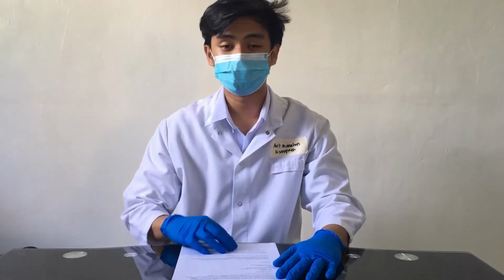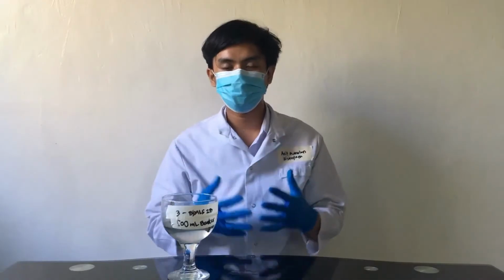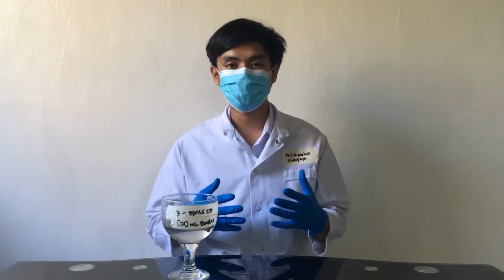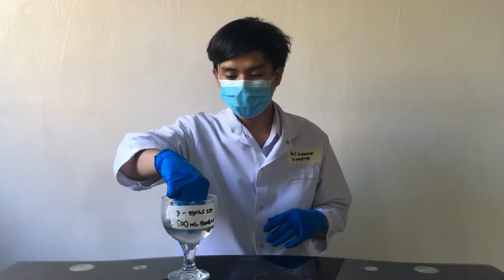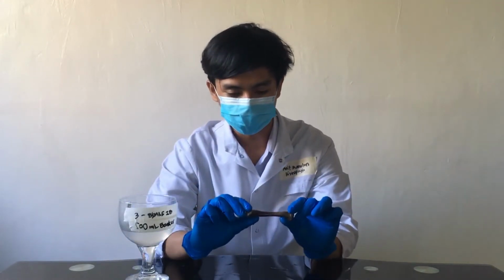And after that, we now have to test the extent of decalcification. To measure the extent of decalcification, we have 3 different methods. But for this experiment, we would only perform the physical or mechanical test. This test would require you to touch and bend the bone or any calcified tissue immersed in the decalcifying agent. So let's try to bend this bone specimen we have to measure the extent of decalcification.